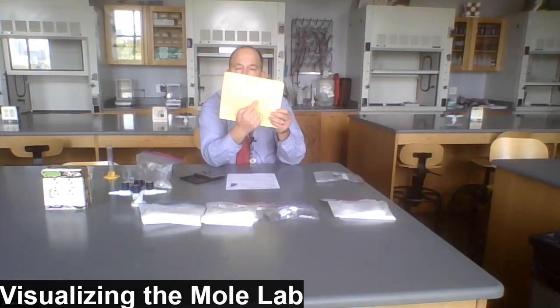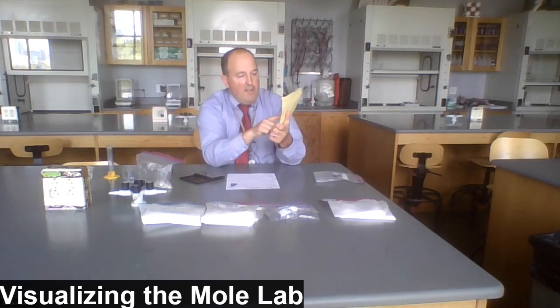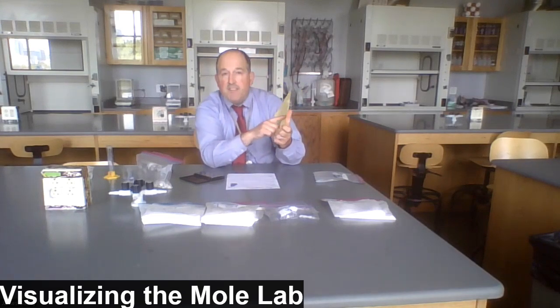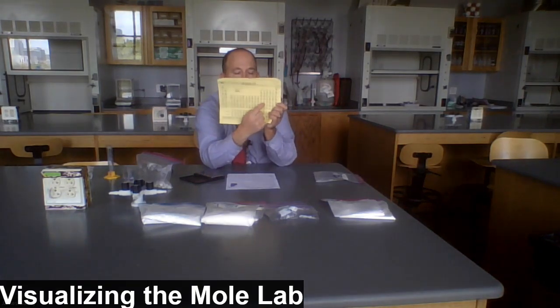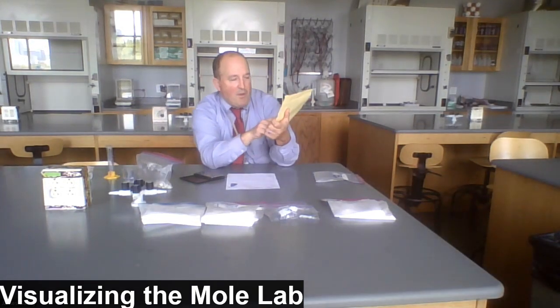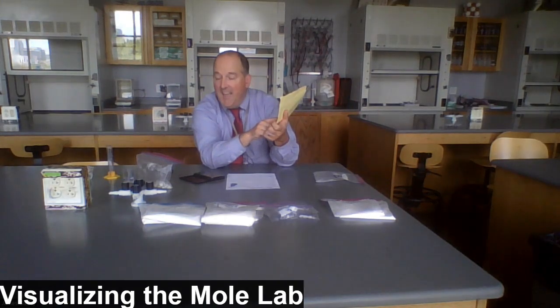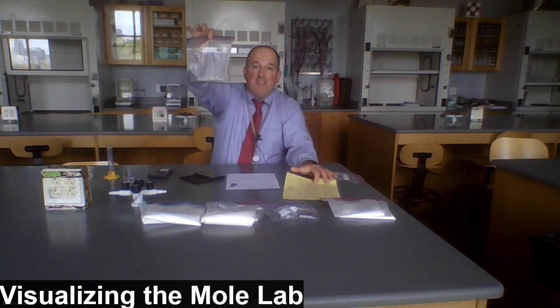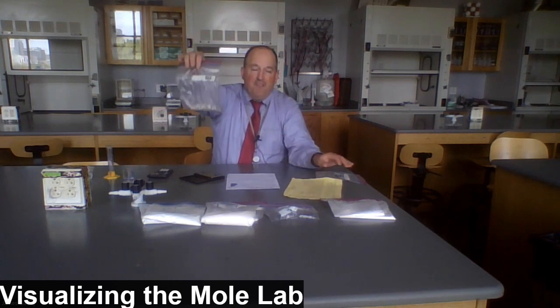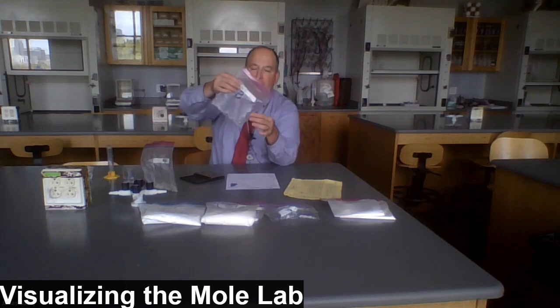Zinc is element number 30, and its atomic weight is about 65. Tin is element number 50, and its atomic weight is about 119. Hey, this is tin because I know I've got a 1 mole sample. Let's verify that by weighing the other bag.